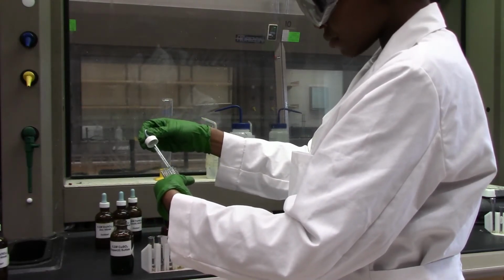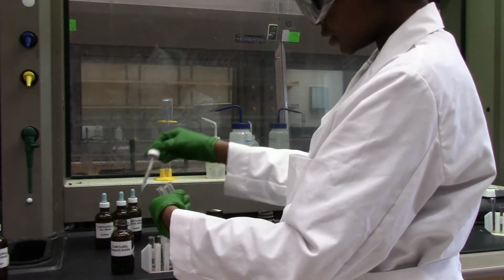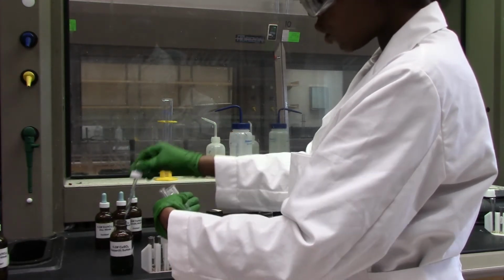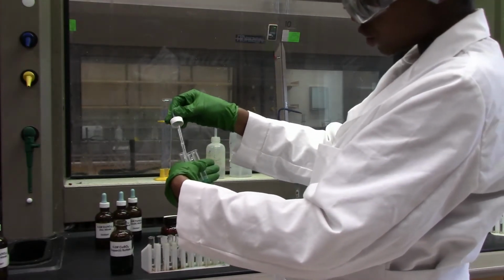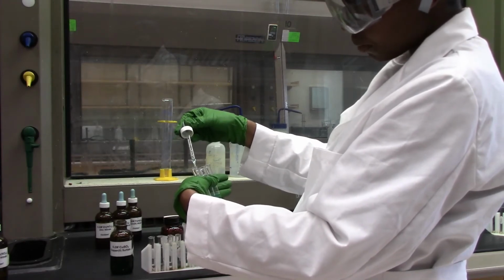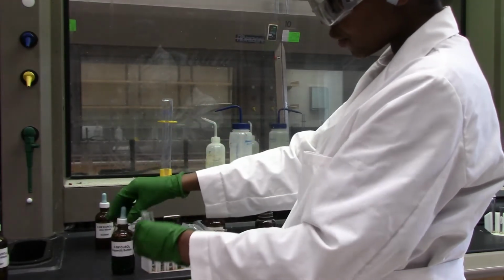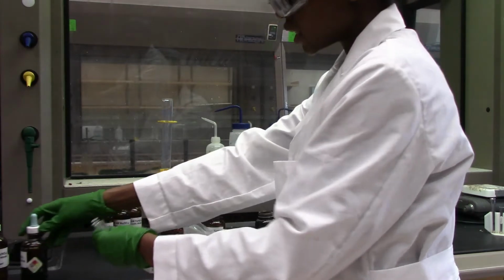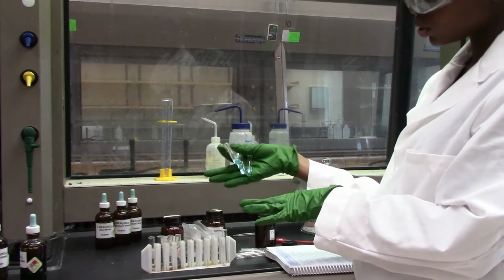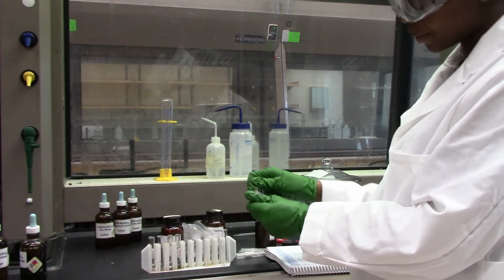Observe the color of the solution. It's bluish in color. And so we'll be looking at change in color of our metal or change in color of the solution in order to rate the reactivity of the metal with the metal solution. For example, if any metal changes the color, that means it displaces the metal ion from its solution, and then that metal will be more reactive compared to copper.